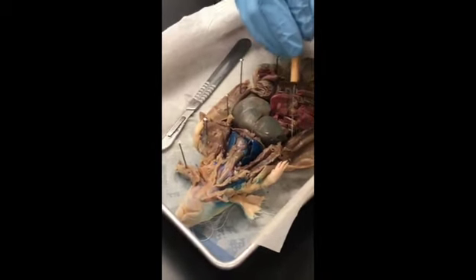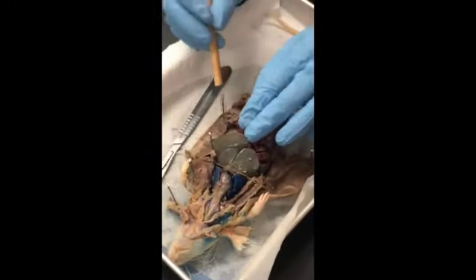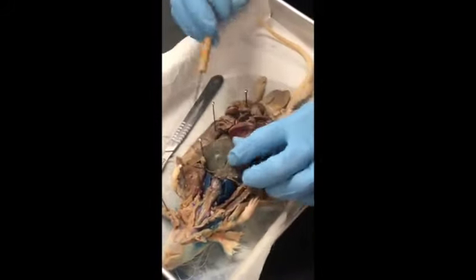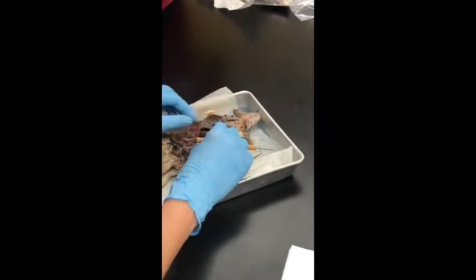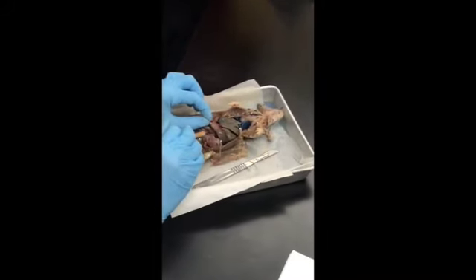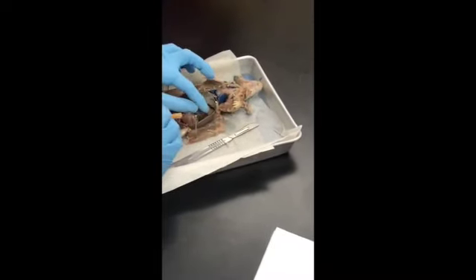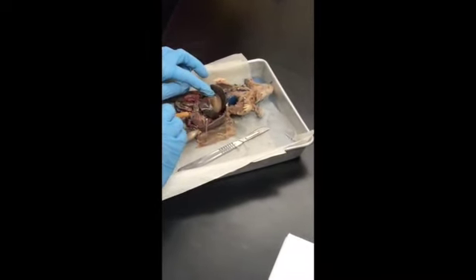left, right, and the right has two parts. There's two parts to the right, and then the caudate lobe is way down here underneath. Can everybody see that? The caudate lobe. Okay, stomach. Pancreas is this, just like a little fatty glandular structure. Spleen.